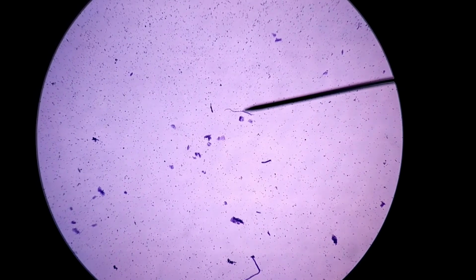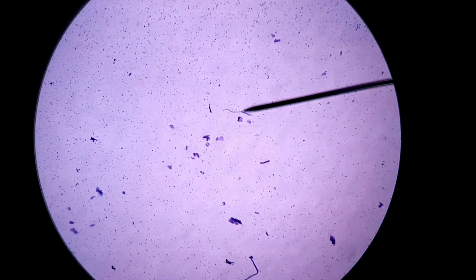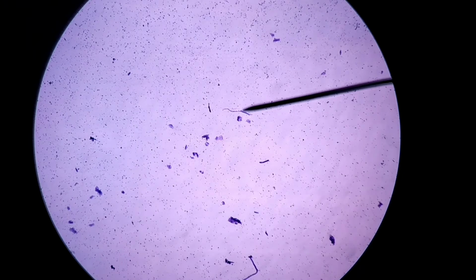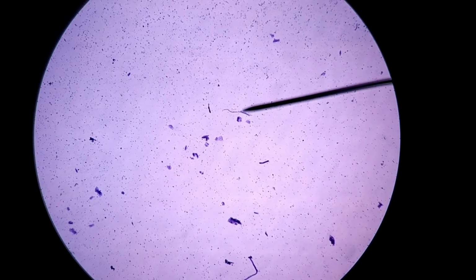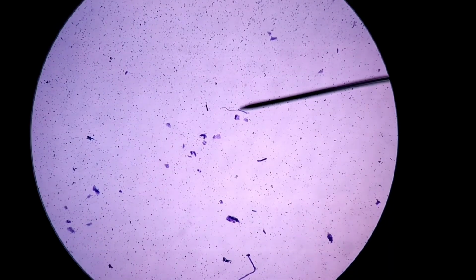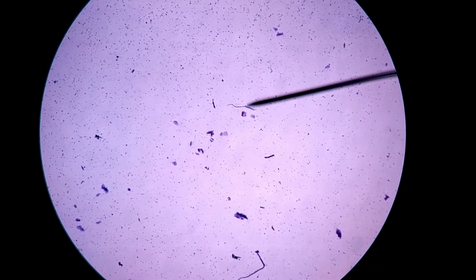All right, so now we're looking at a view through the microscope, and this is under the lowest power called scanning lens or scanning power. And all those little objects that you see scattered around that are a little bit larger are mostly cheek cells. At the end of the pointer, which is that black needle device coming from the side right, it looks like maybe there's some kind of a hair or something, which doesn't surprise me. I think the slide itself was kind of dirty.